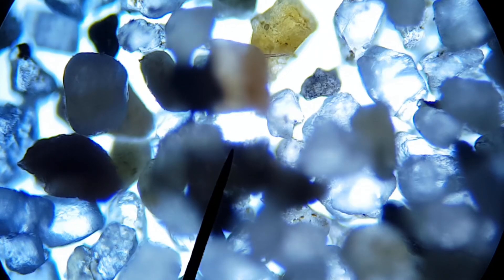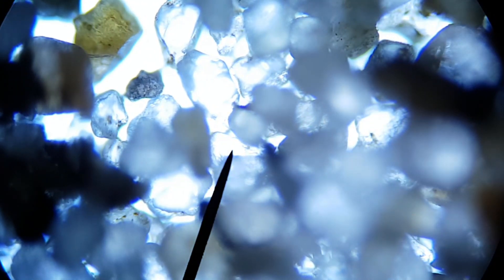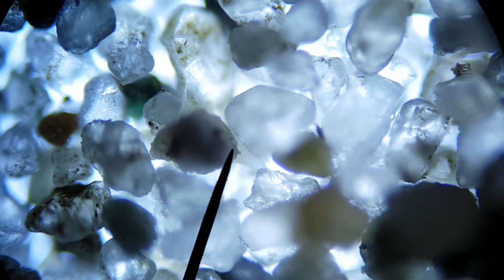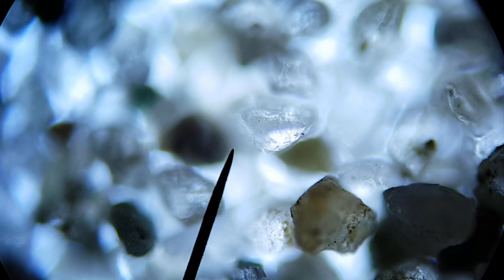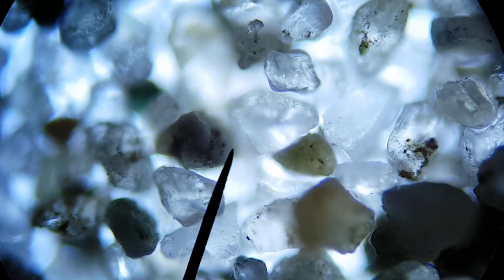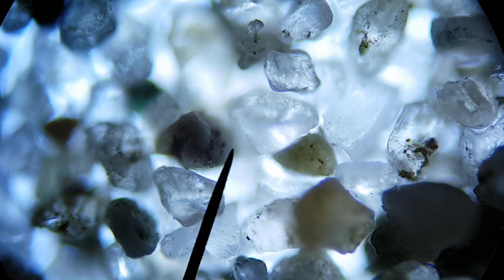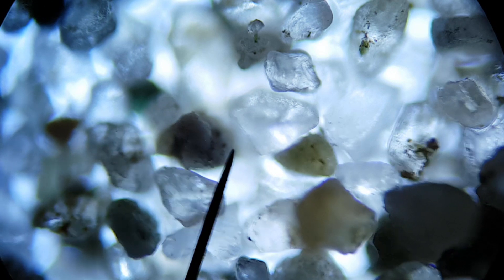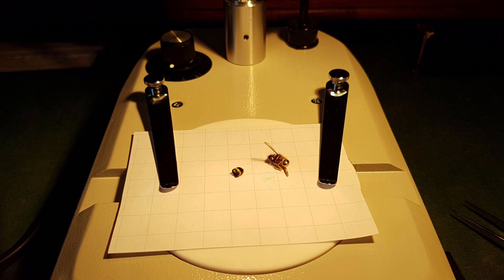There are lots of different grains of sand, probably from lots of different types of rock, and that's pretty much all the interesting stuff I have to say about sand. I think I might do this again in another episode but with different types of sand to see if that makes it better. Anyway, that's the sand for now.